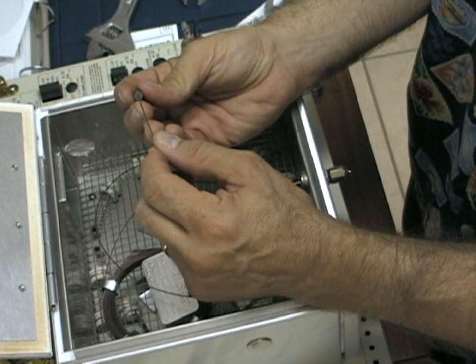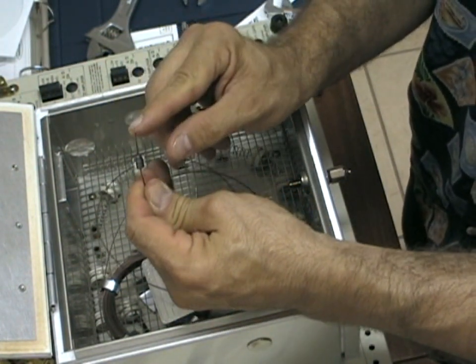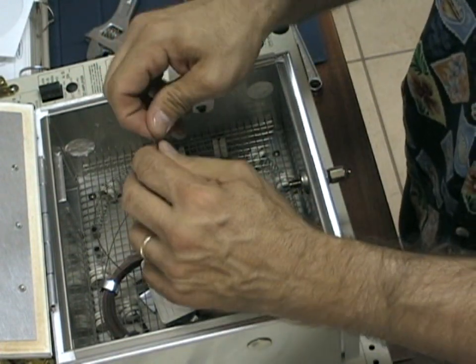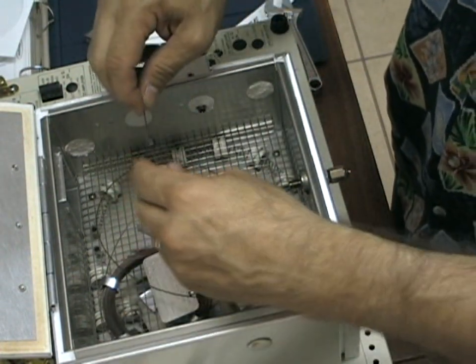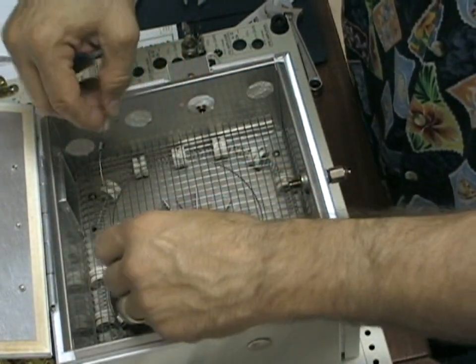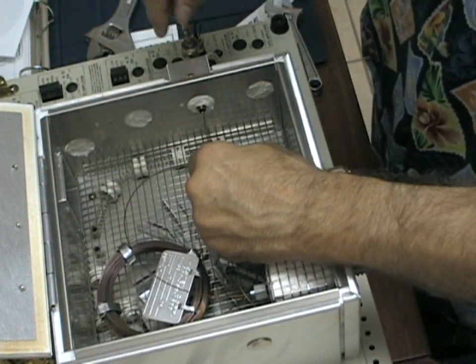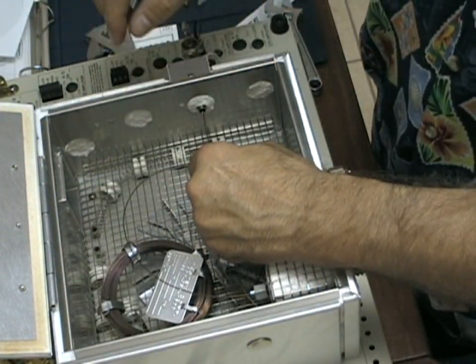Place the nut over the end of the column. Slide the graphite ferrule, again carefully twisting it so that you don't clog the end of the column with graphite, and then insert this into the FID fitting.